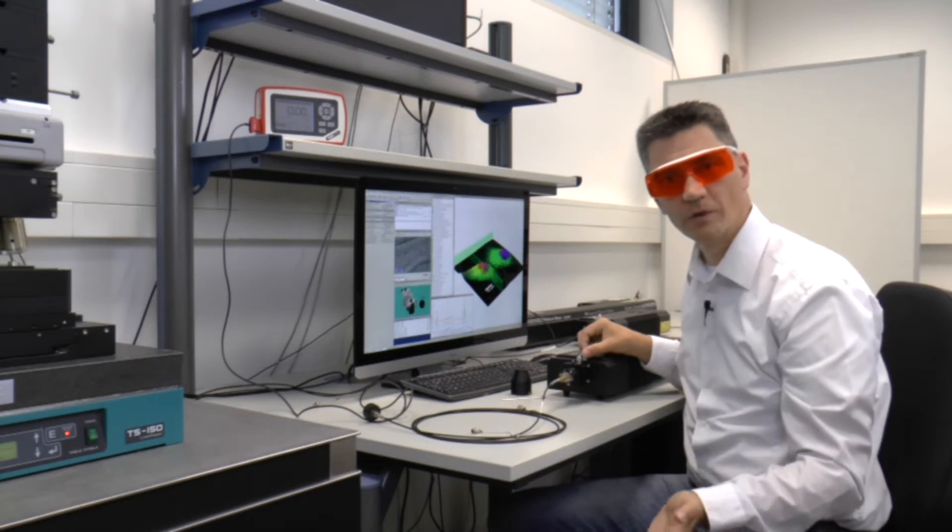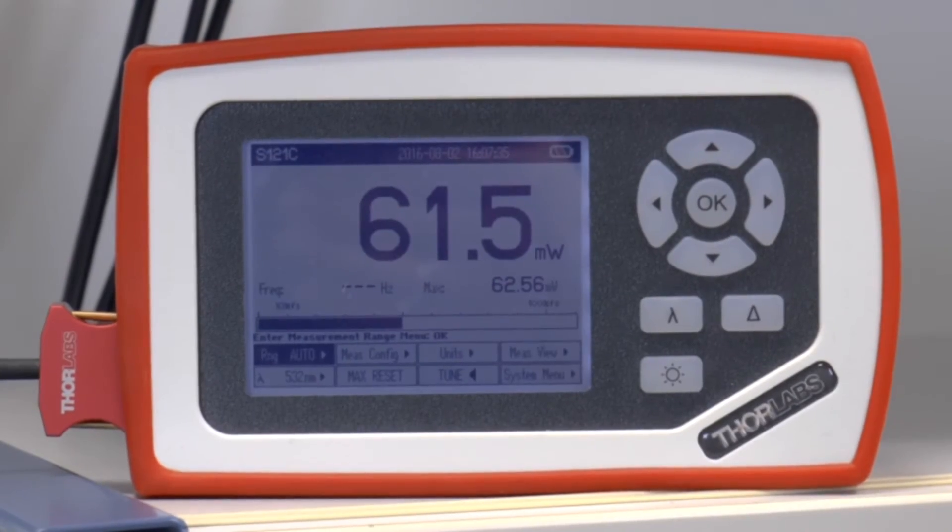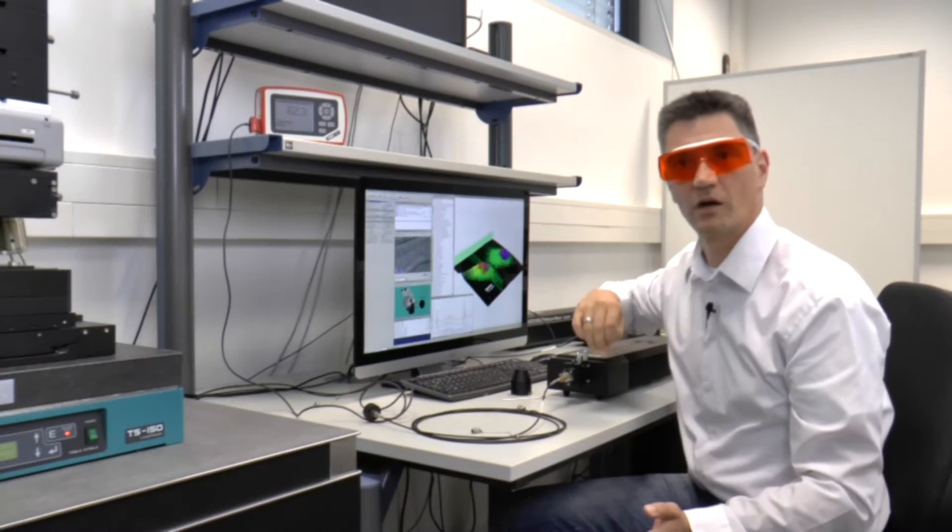If I now open the laser shutter we can measure the power transmitted and we see it's about 62 milliwatts so the transmission efficiency is extremely high.